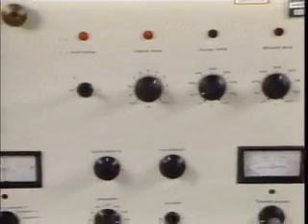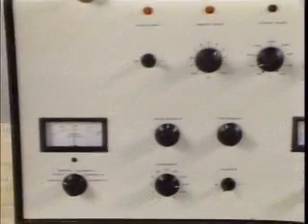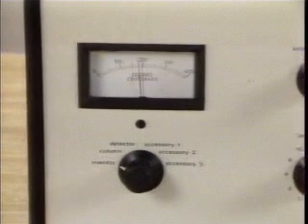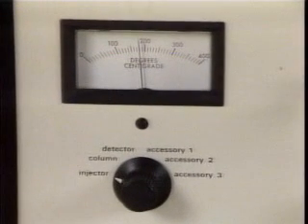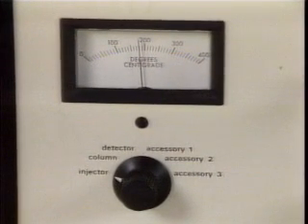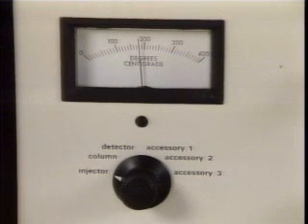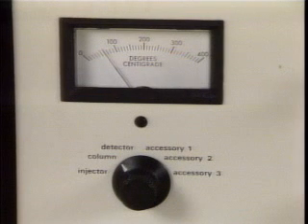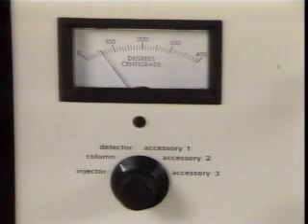Since it is necessary for the sample to enter the column all at one time as vapor, the temperature of the vaporizing chamber behind the injection port is set well above the boiling point of the highest boiling component of the mixture. Within the column, where it is necessary for the components to equilibrate between the liquid and vapor phases, the temperature is set lower than the temperature of the injection port.